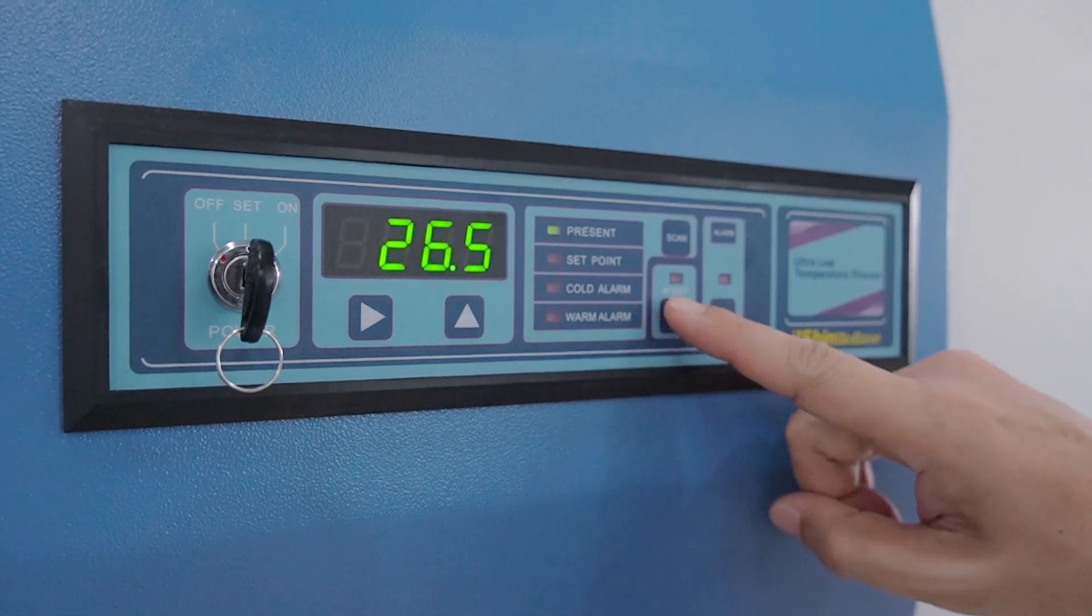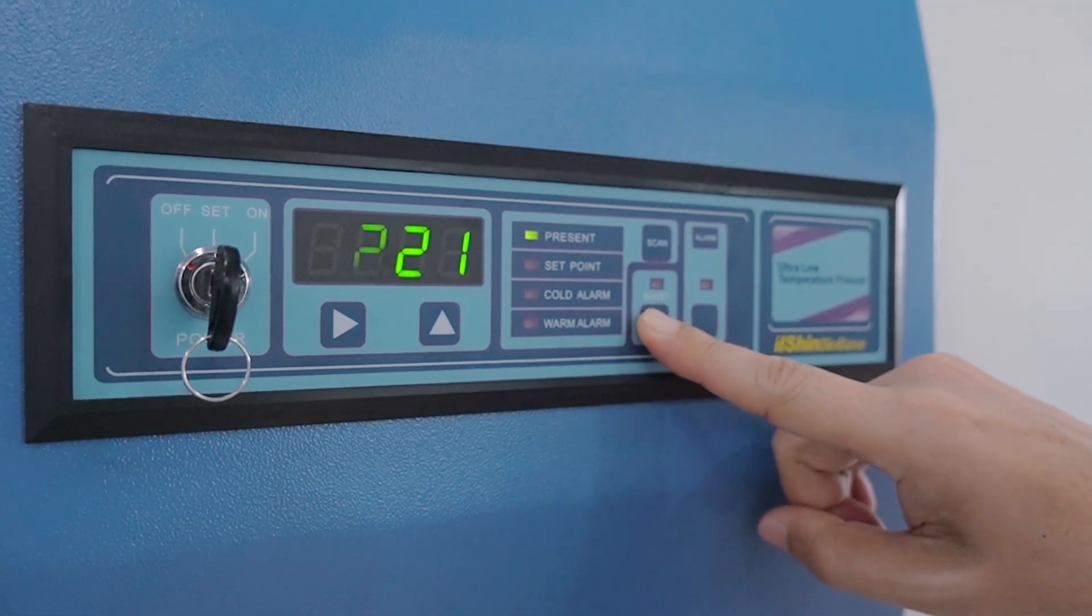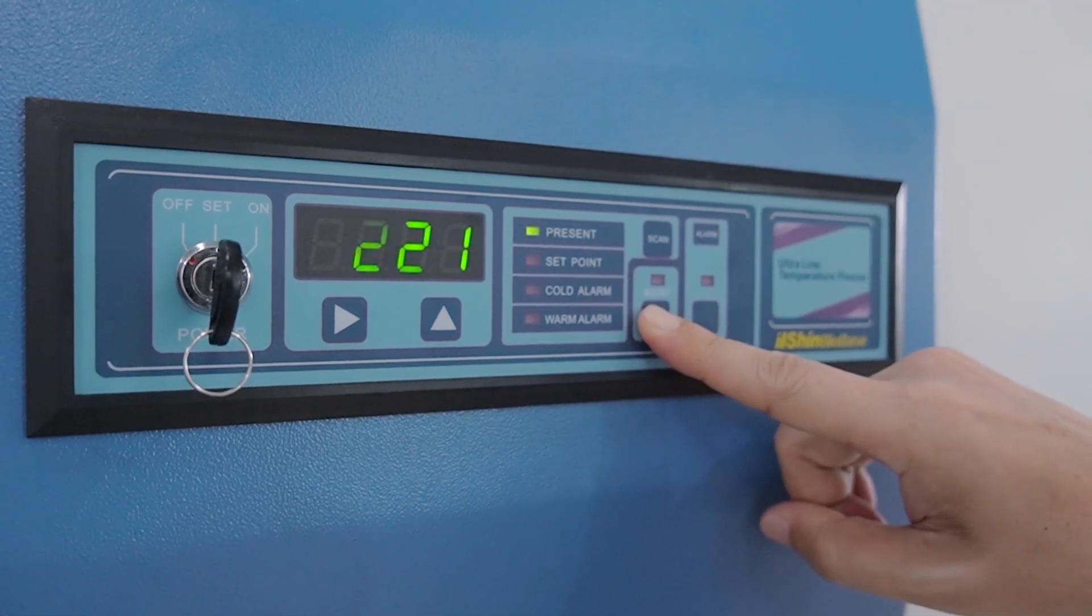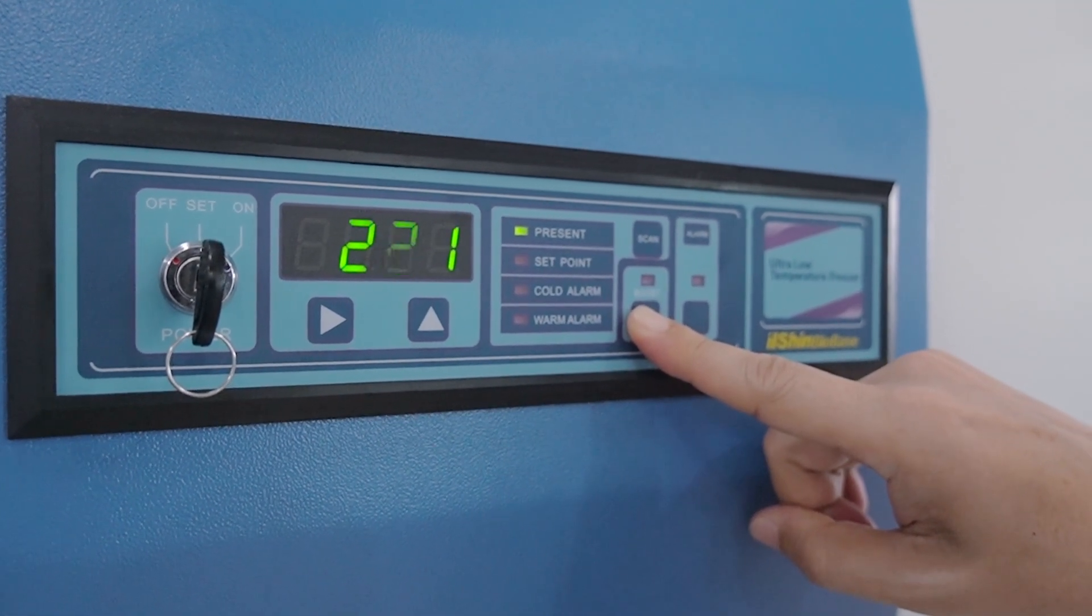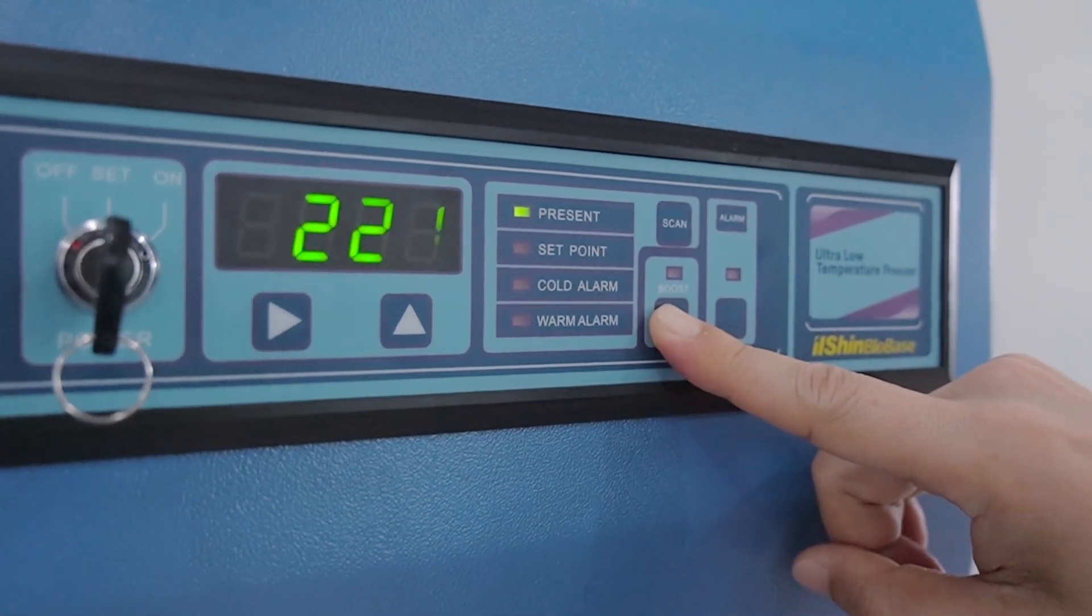Push voltage button to check inlet voltage. Proper voltage is within 5% variation from standard.